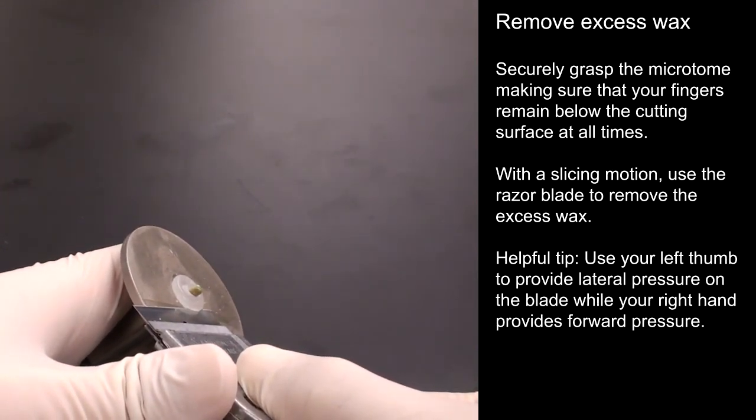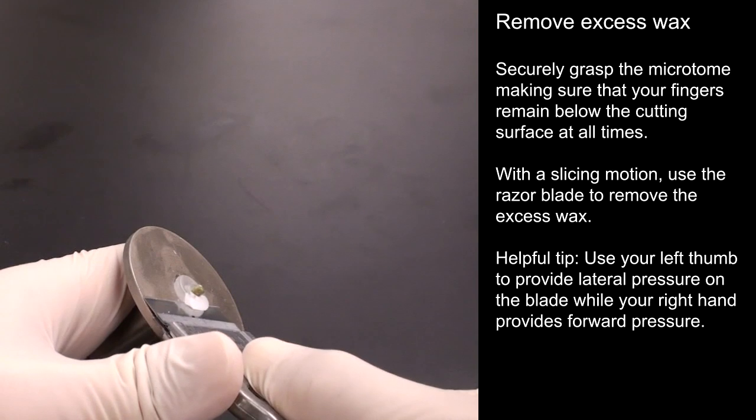You can use your left thumb to provide lateral pressure on the blade while your right hand provides forward pressure.